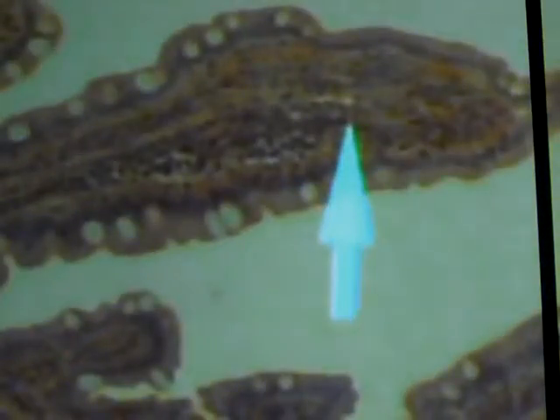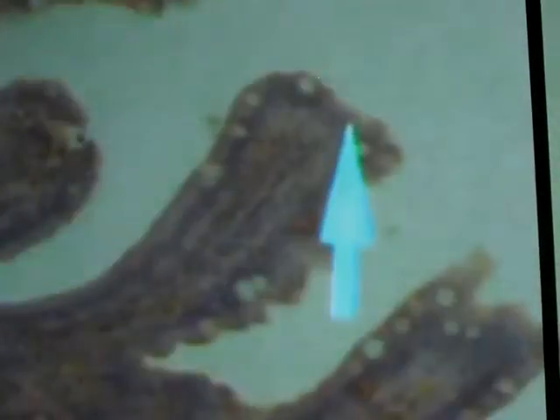Also in the villi, I don't know if you'll see it here, but you see these lymphatic vessels that are present in the villi, which is pretty much the beginning of the lymphatic system in the small intestine. Those are called your central lacteals. Sorry, we're not really seeing it here. So we might see them on one of the other slides. I don't remember if that was on.